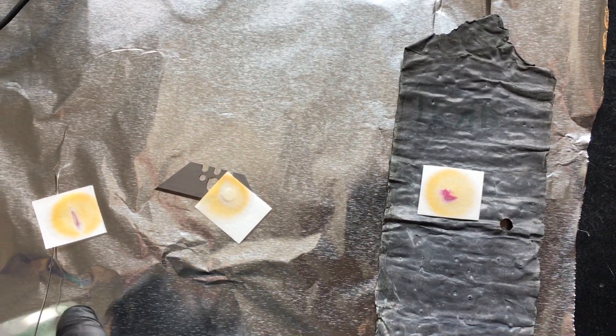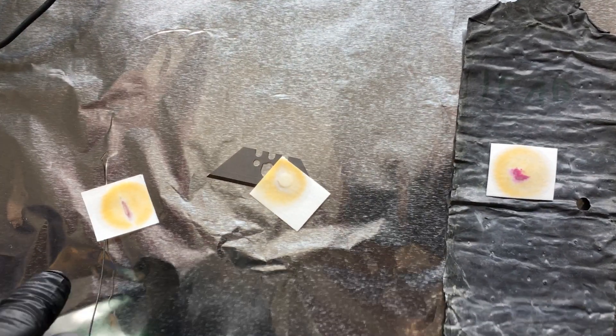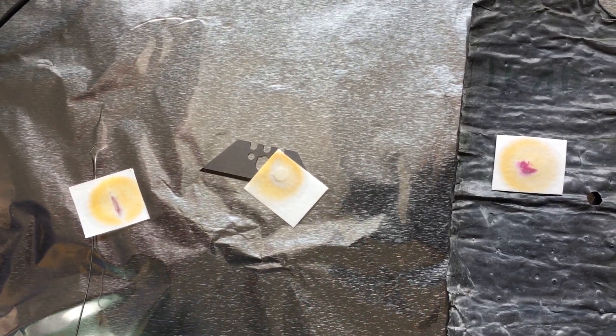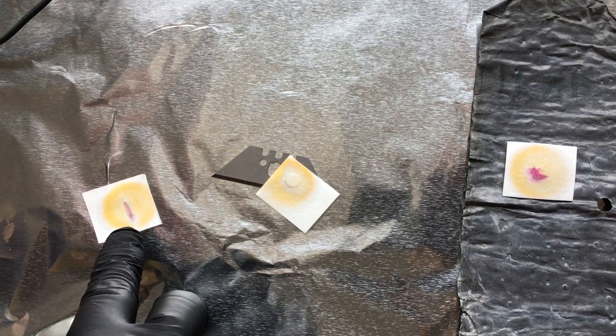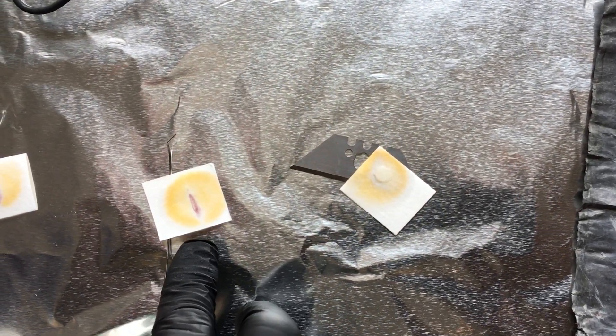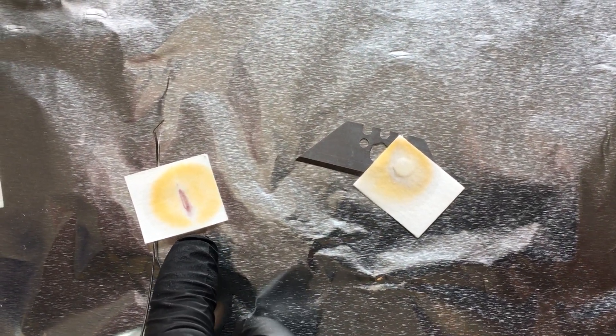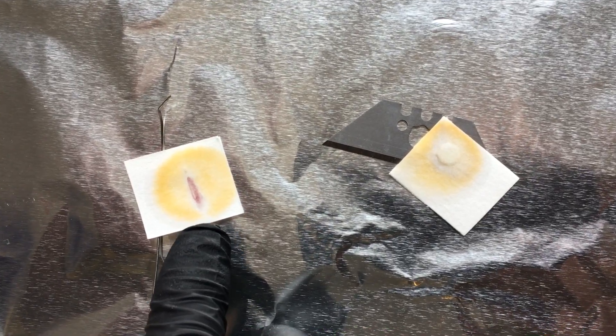Now, this is the tricky part. The lead-free solder, you may see a little bit of purple, but I see mostly gray. So it's gray with just a hint of purple.